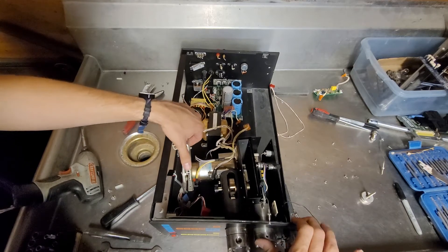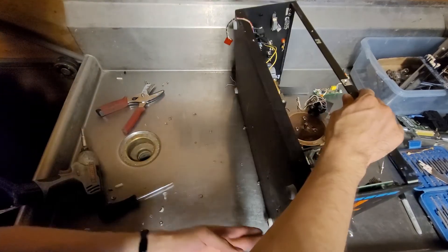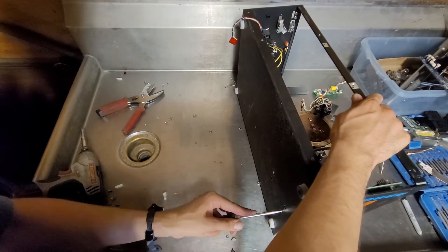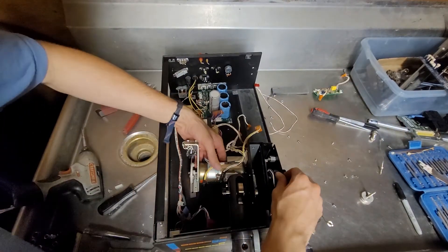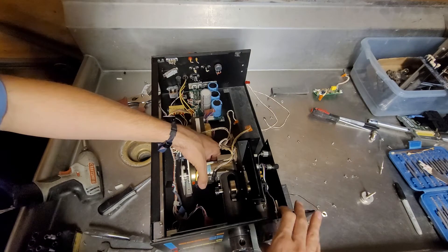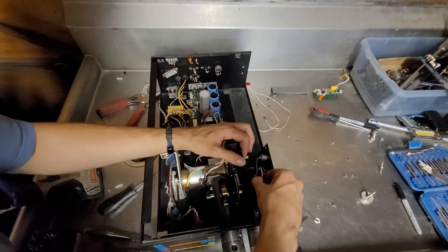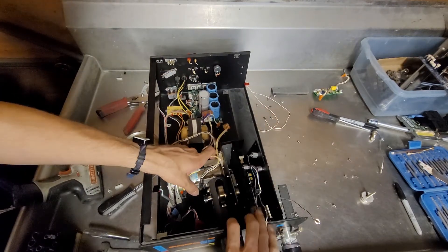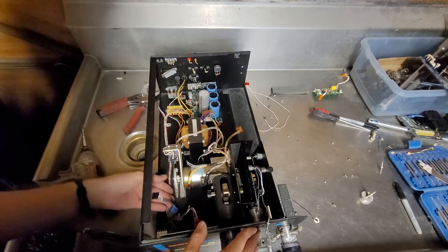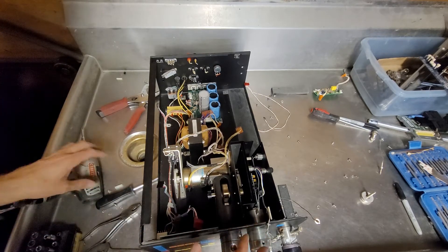Still wants to hold on. There's a little nub of plastic that's giving it something to hold on with. So many sharp corners. I think there's some other stuff hanging me up here as well. I really would like to reduce the amount of stuff in my way. Can't get to it anyway.